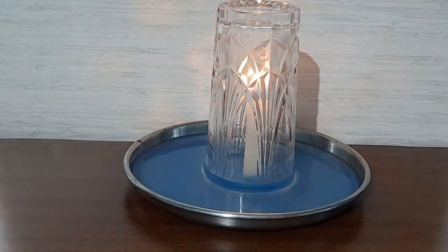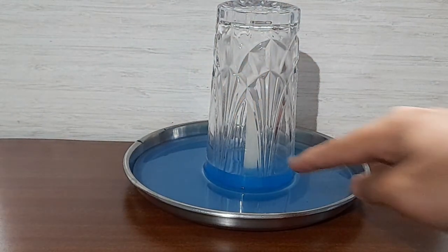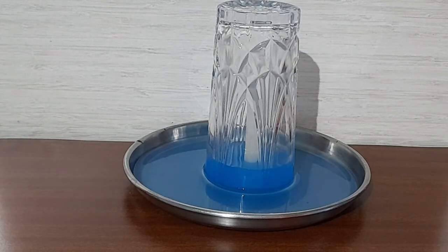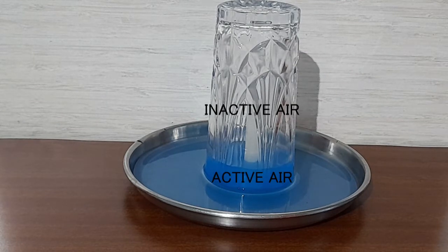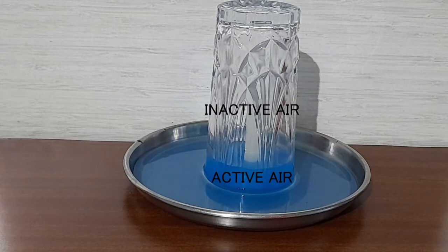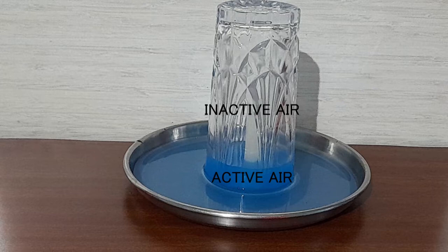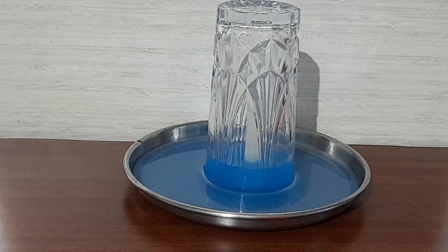You will observe that the water level rises and the candle goes off slowly. This proves that the one-fifth part of the beaker is filled with water, representing oxygen or active air, whereas the four-fifth part of the beaker is nitrogen, which does not support burning and is inactive air.